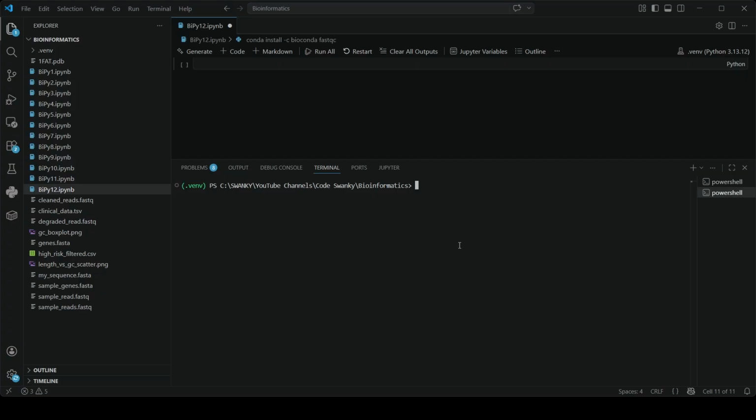This might be something that people who are already in biology or genomics might know, but if you are someone from a computer science background, this might be a good exercise for you. So let's open up our terminal in VS Code over here. And if you're on Linux or using Windows Subsystem for Linux, installing FastQC is incredibly easy. We can use the standard package manager.